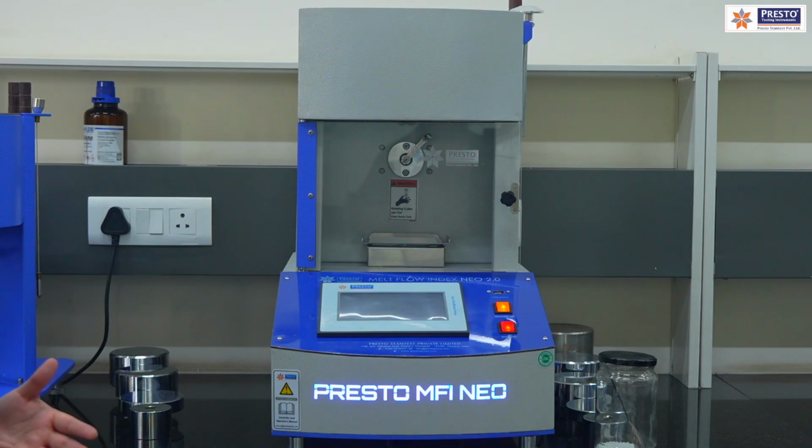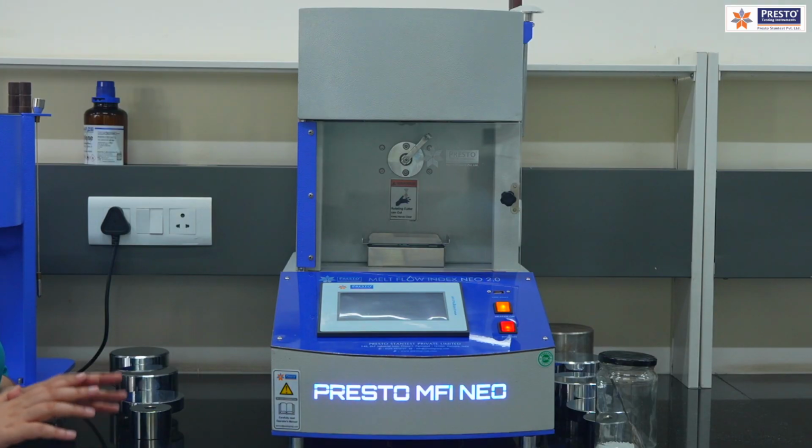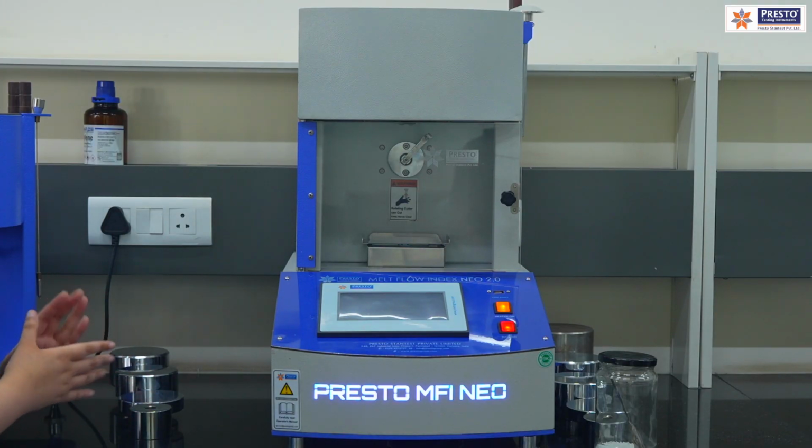it can help in handling the fast or the testing in more accurate manner, because it will help us to handle the things and the manual interventions in this, and those things will be neglected in this.